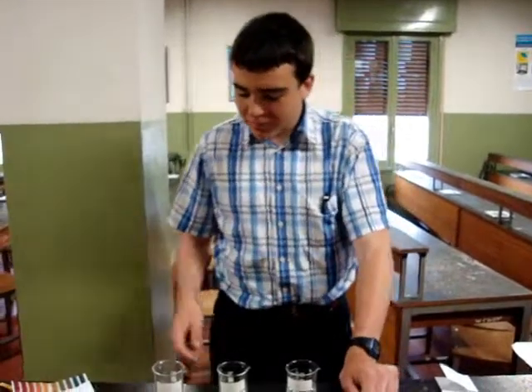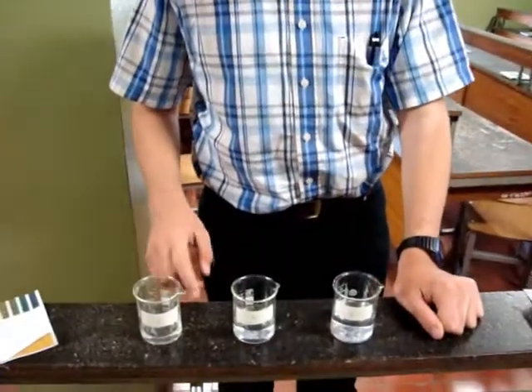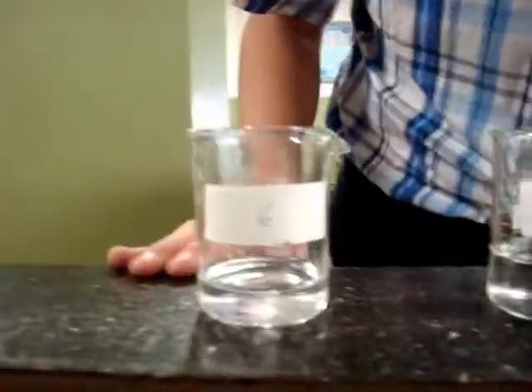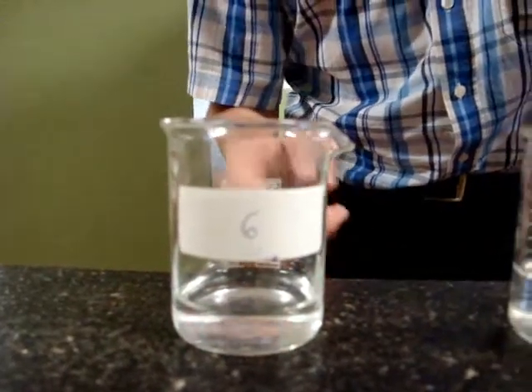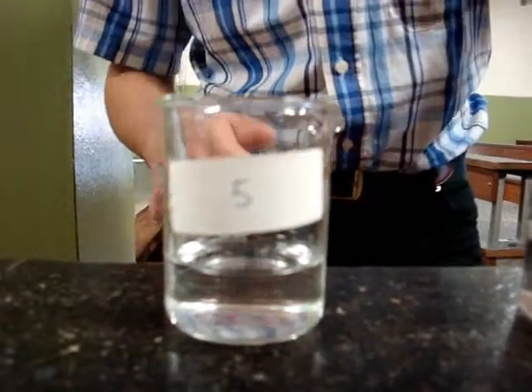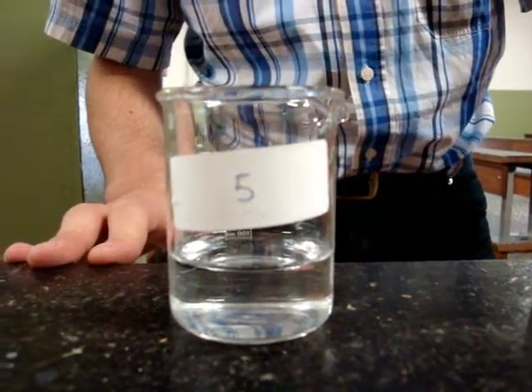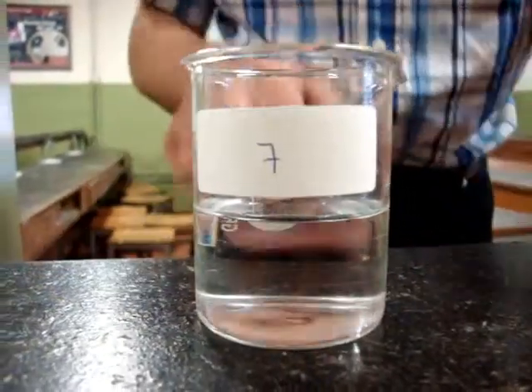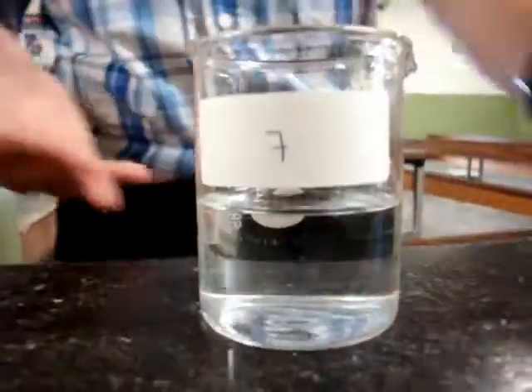Hi! We are going to make some practice about acid and base components. Here in this pot we have a hydroxide, a basic substance. In the number 5 pot we have water, pure water, just H2O. And in this glass we have a hydrochloric acid, an acid substance.